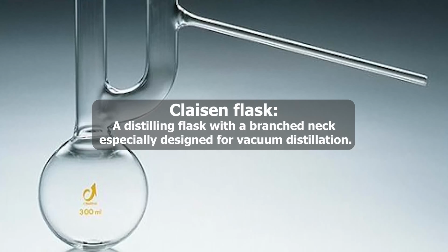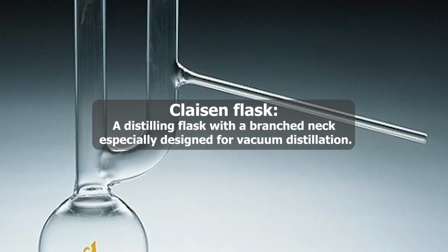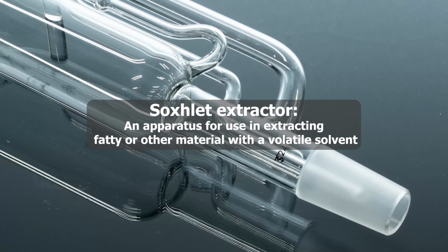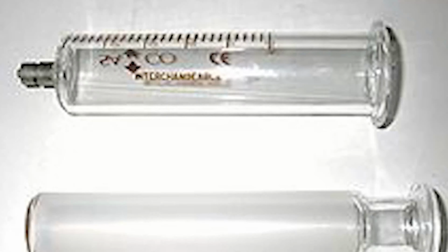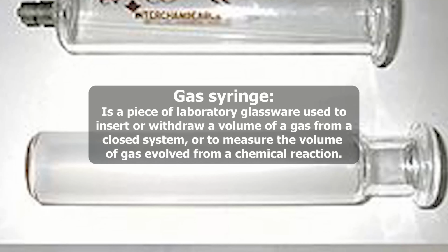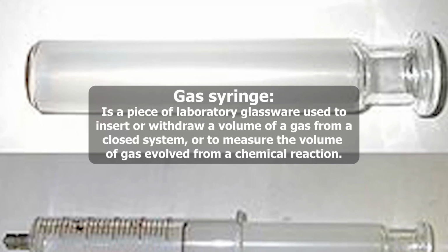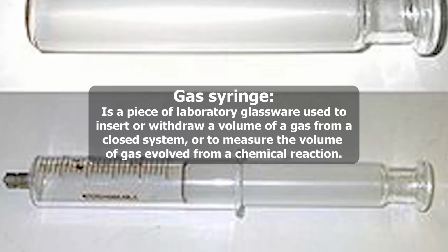Claisen flask, a distilling flask with a branched neck specially designed for vacuum distillation. Soxhlet extractor, an apparatus for use in extracting fatty or other material with a volatile solvent. Gas syringe is a piece of laboratory glassware used to insert or withdraw a volume of a gas from a closed system or to measure the volume of gas evolved from a chemical reaction.